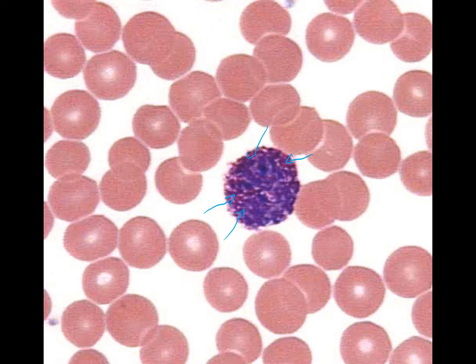And so you need to be able to identify the individual endocrine cells, the endocrine tissues, and then the cells that may appear on those endocrine tissues. And then you need to be able to identify the white blood cells, be able to give the relative percentage that we may find them in the blood, as well as what type of infection is going to bring those white cells up if we have a particular infection. So if we have, say, a basophil here, what is going to make that basophil become elevated in its numbers? What kind of a problem with the immune system is going to cause that to occur? And that will do it for our endocrine and blood cells.